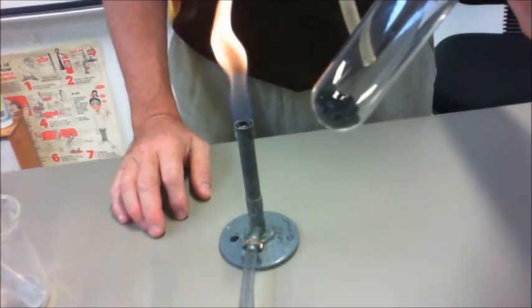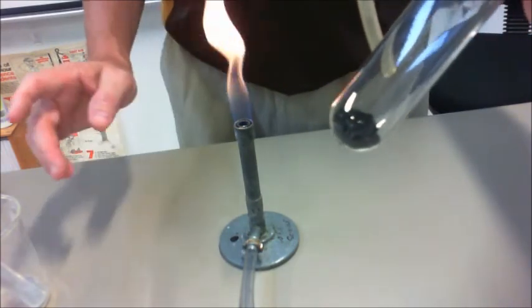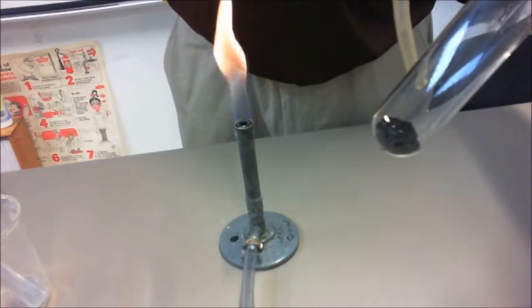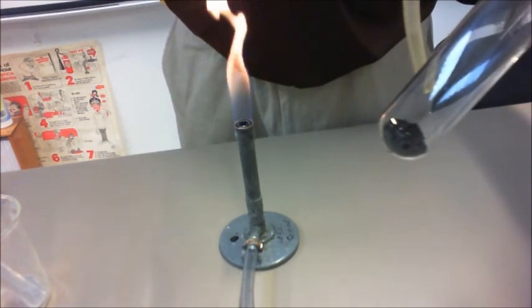So, our copper carbonate has become a new substance, as well as producing the lime water, which is an indicator for a particular test.